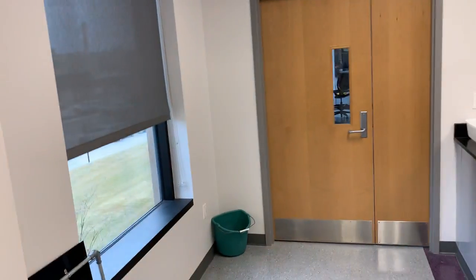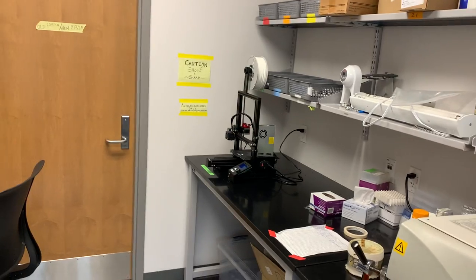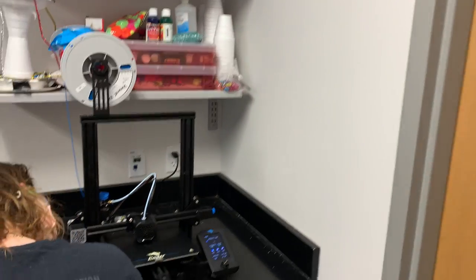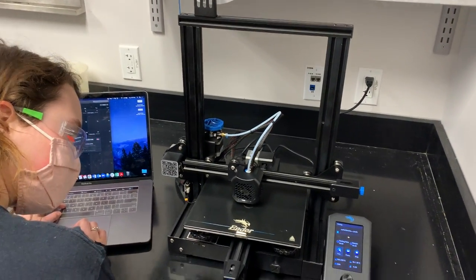We continue through into our microscope room, but before we get there we see Emmaline, who is working on one of our two 3D printers where we are printing novel technologies. We can see some of the devices here — we make inserts for the co-culture projects, and we also have another project in which we 3D print devices to study cell migration.